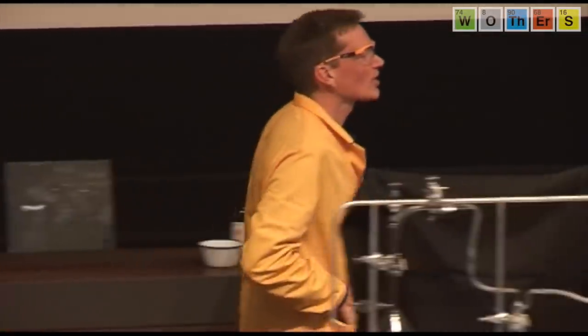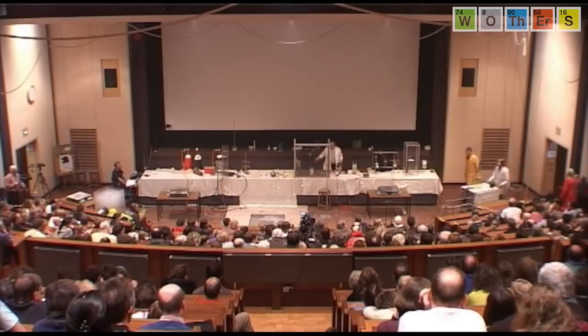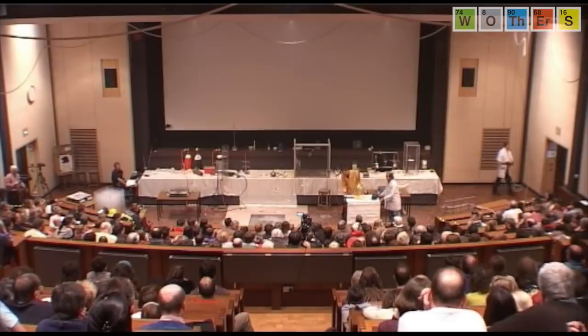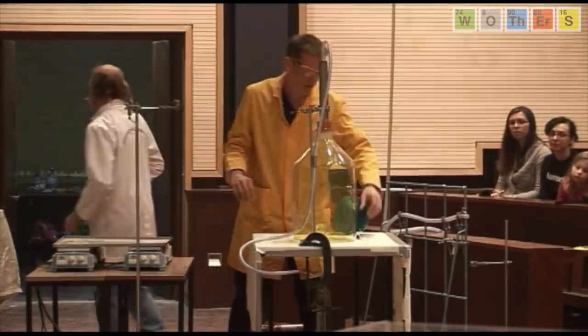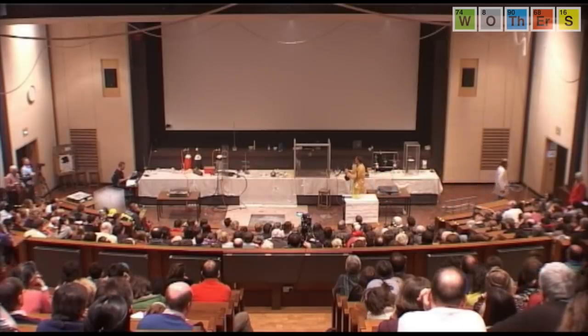Well, we can. Now, Chris has filled up this apparatus here with another gas, chlorine. Now, chlorine is very poisonous, so we've had to take precautions here to absorb any chlorine that's coming out through the apparatus. But I wanted to show a reaction now with no oxygen whatsoever. Now, in this balloon is another gas. It's a hydrocarbon called acetylene.